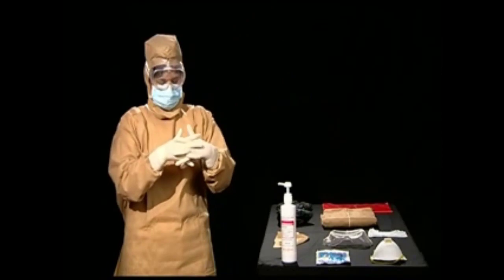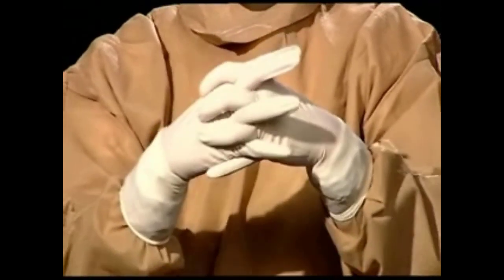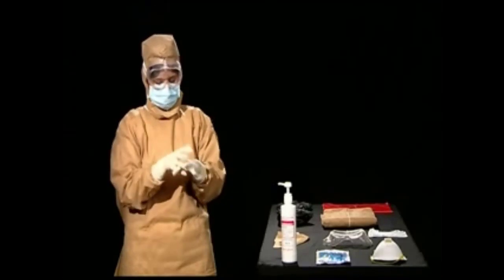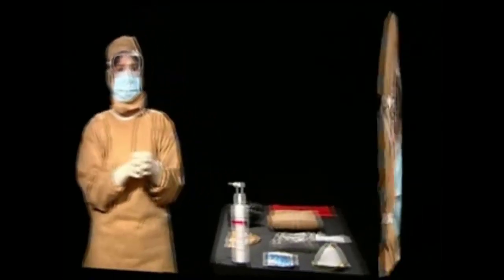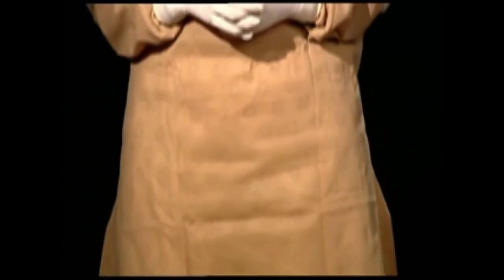Repeat the same exercise with the other hand. Once both the gloves are on, stretch and lock your fingers to ensure proper fitting of the gloves. It is very important that the wearer keeps the gloves away from coming in contact with any part of the PPE after putting them on.